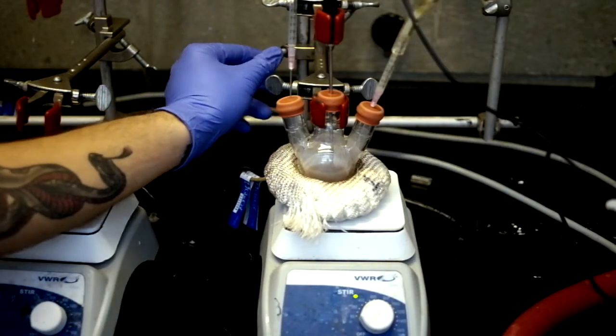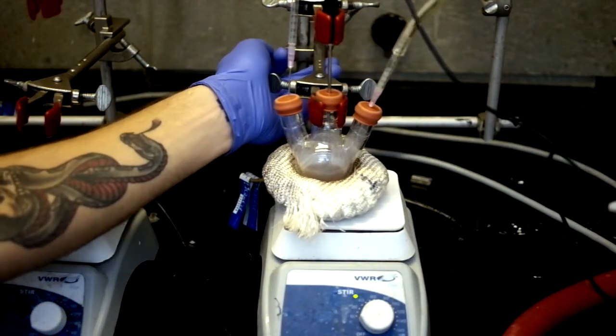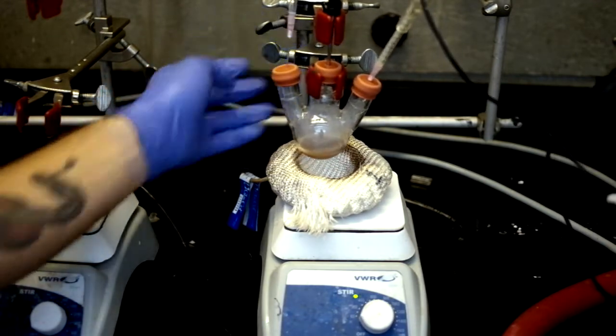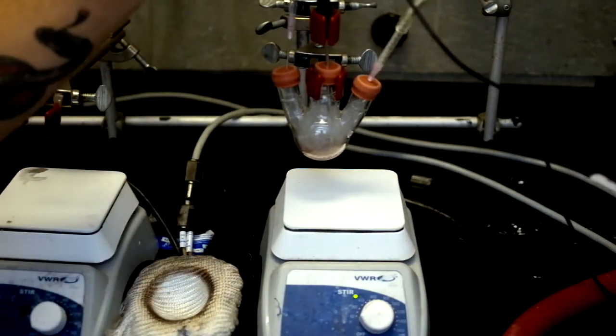After the reaction has run for about 4 minutes, or if any aggregate is seen to be forming in small chunks in the solution, take the reaction flask off of the heat to quench the reaction.